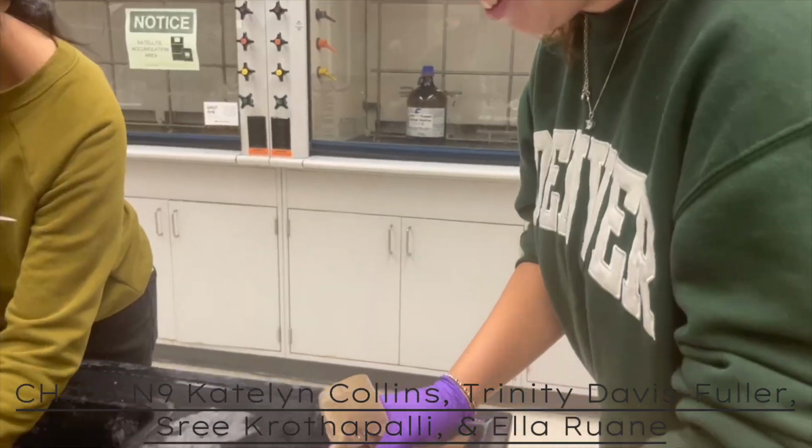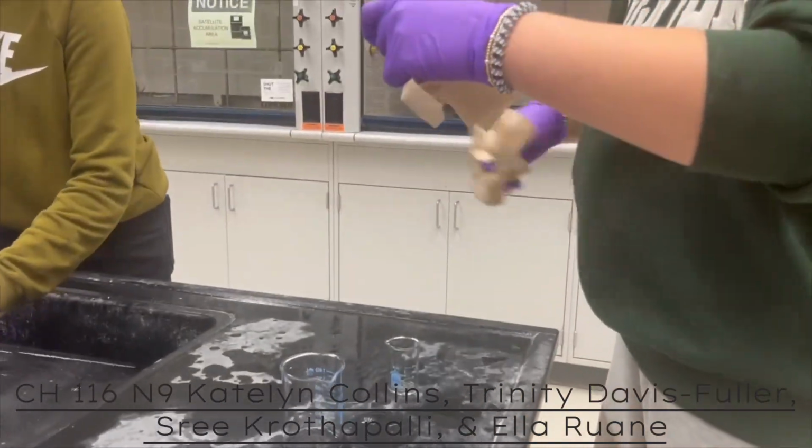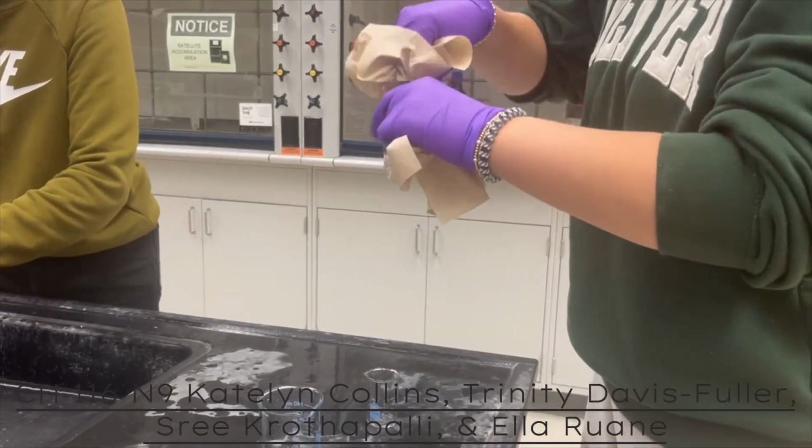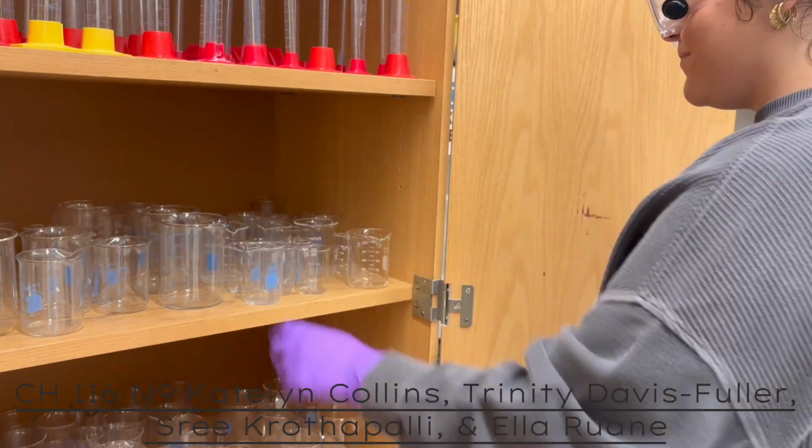Be sure to shut down the machine area and clean up your group's lab space. Dispose of all waste in the designated waste containers, and clean the cuvettes using soap. Rinse with water, thoroughly dry each piece, and put away each piece in its designated storage area.